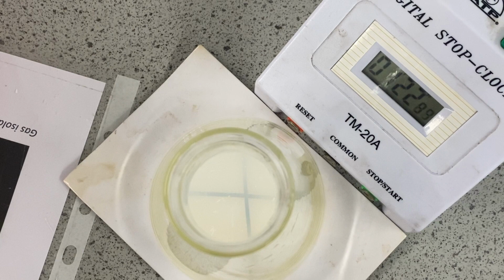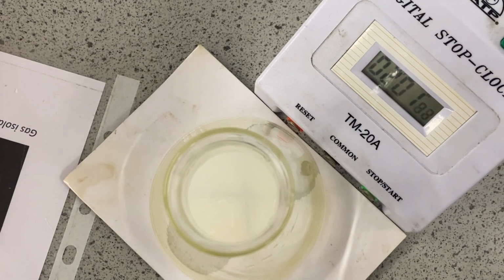The independent variable, the thing that we have chosen to change in this experiment, is the temperature of the reactants. So that's the thing we're choosing to change. Independent variable is the temperature. The thing that we're measuring in this particular reaction, our dependent variable, is the time it takes for the cross to disappear. In a different reaction, we might say it's the rate of reaction, which is true, but the thing we're actually measuring is the time it takes for the cross to disappear. That's what we would write as our dependent variable if we're asked about this particular experiment. Now, I can just about see the cross through the solution.